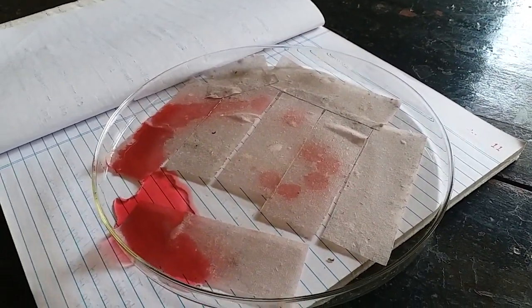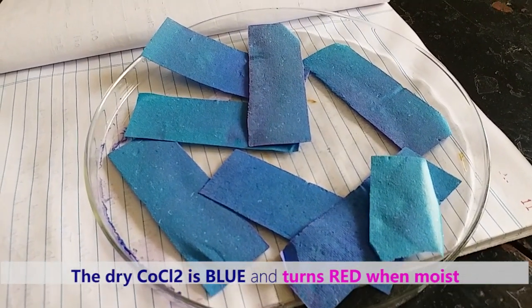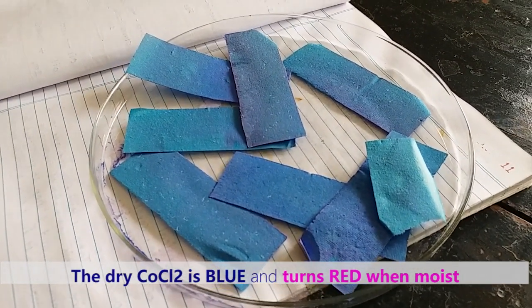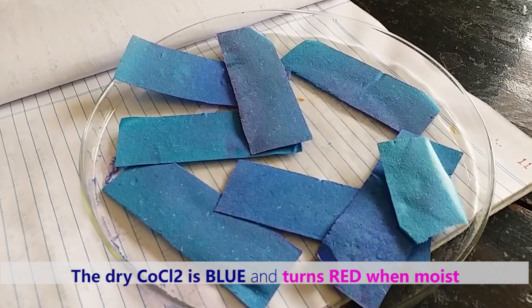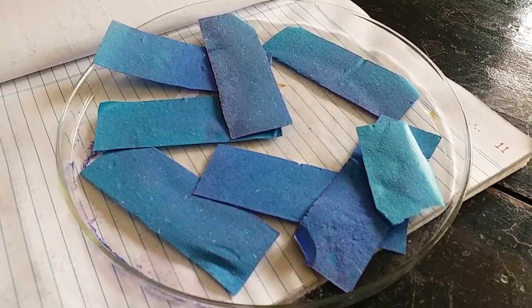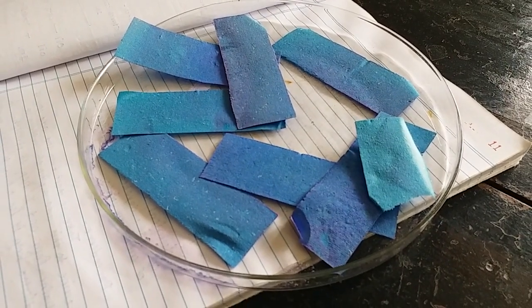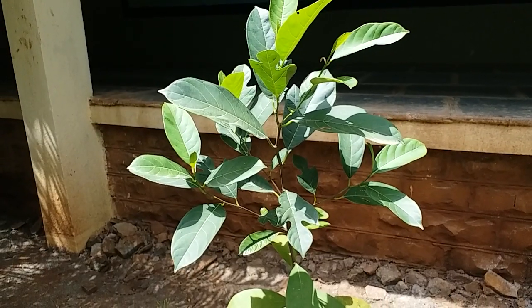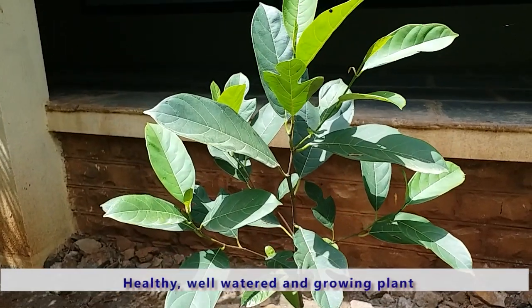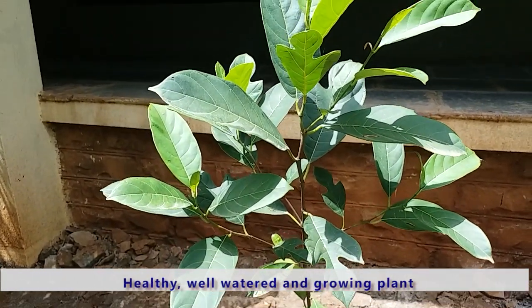These are dry cobalt chloride papers, which appear to be blue. When they come in contact with moisture, they turn red. This property we will use to determine the rate of transpiration. We will need one healthy plant which is growing well and which is well irrigated.